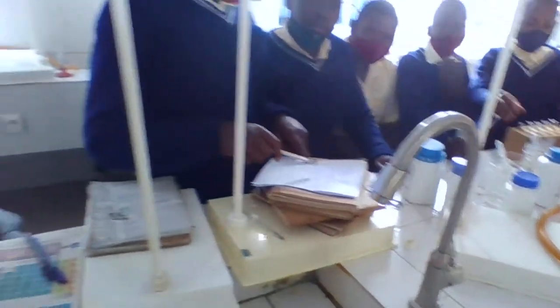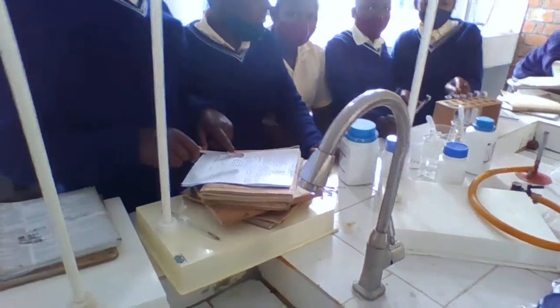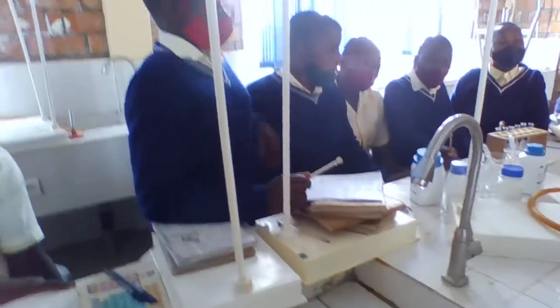You have to read the procedure. First of all, you take a test tube. You put in a quantity of water.